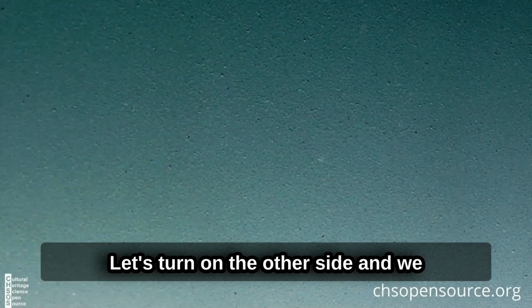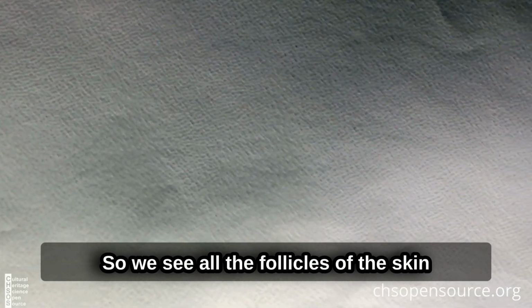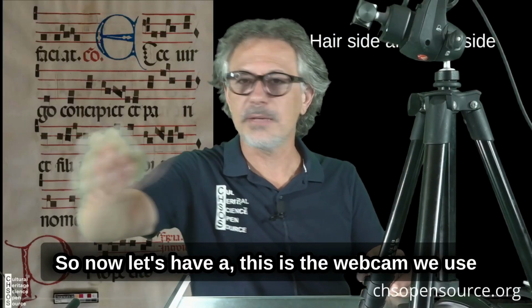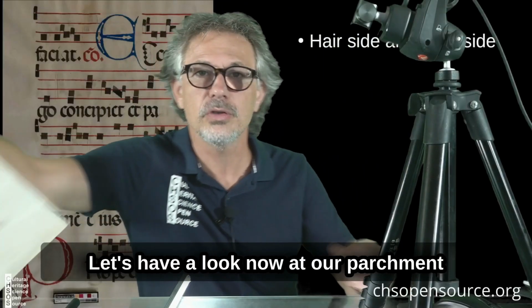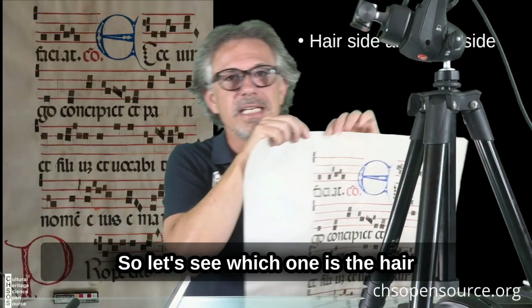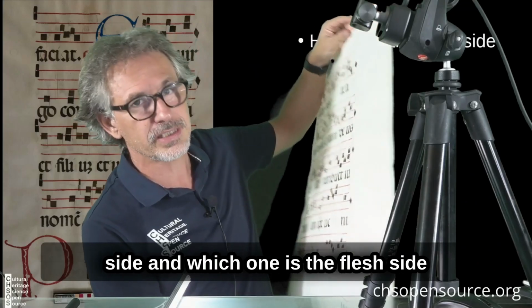Let's turn to the other side, and we see the typical structure of a skin. This is the maximum magnification, and we see all the follicles of the skin. This is the webcam we use. Now let's have a look at our parchment, and see which one is the hair side and which one is the flesh side.